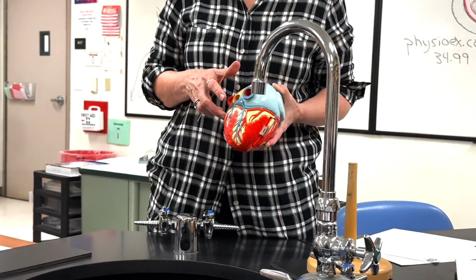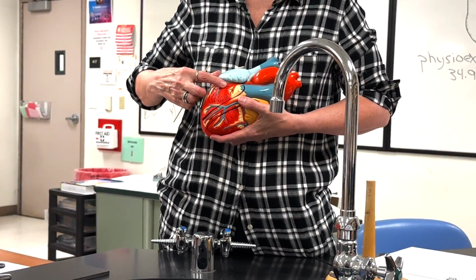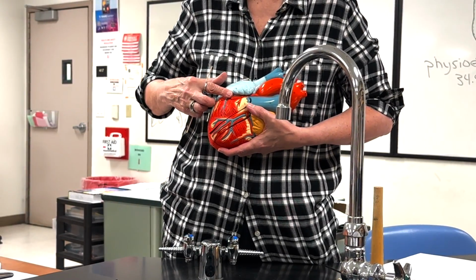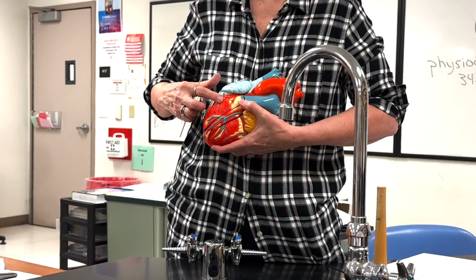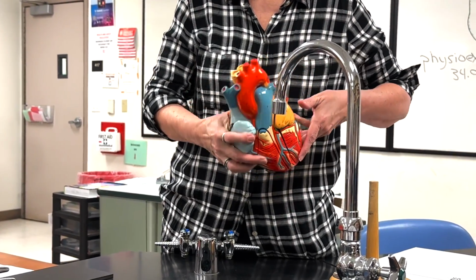Okay. Now in the front, we have a few anterior cardiac veins that don't go into the coronary sinus at all. They just go straight into the right atrium. So that's just showing one of them. Kind of a lonesome one. Okay. All right.